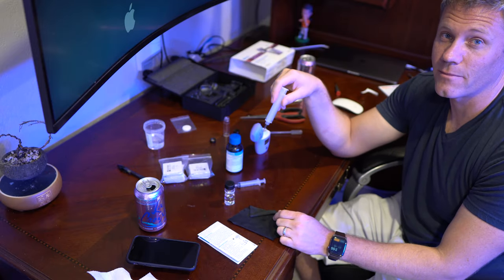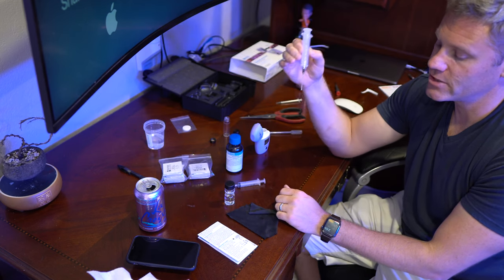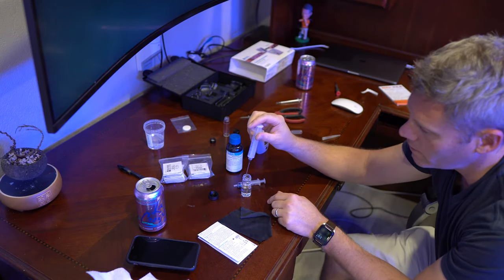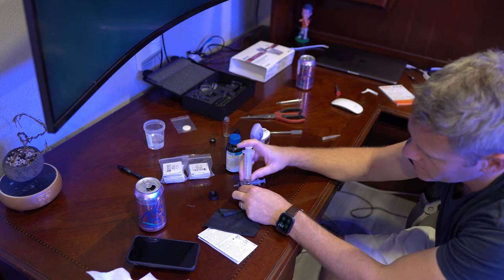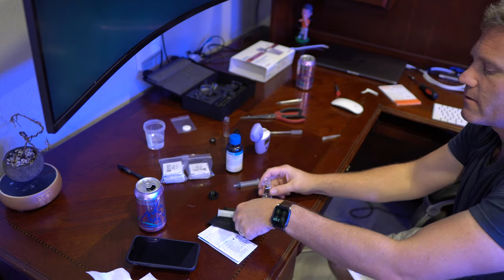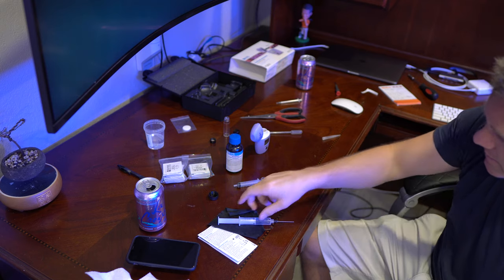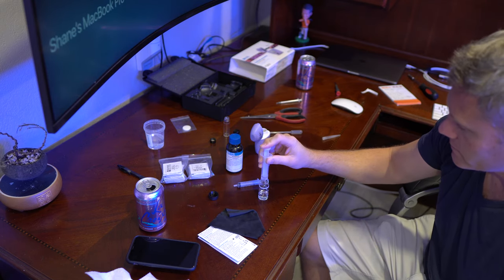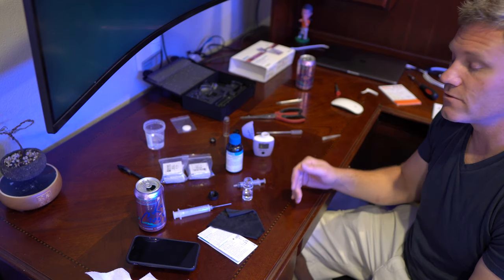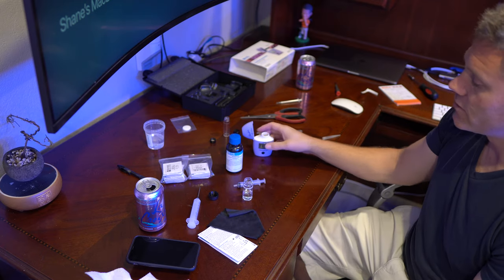The logic is that having exactly seven milliliters — which is easy to get with a syringe — is more important than making sure your dilution is perfectly precise. When you go to pull the seven out, keep the tip all the way down at the bottom and pull up slowly until you get to exactly seven. Discard the remaining liquid. Pro tip: dump it out, give it a little shake to get all that liquid out. Now put the seven milliliters of diluted solution back in. If your parts per million is under five, you don't have to do the dilution — just put exactly seven milliliters of tank water using this syringe. If you do dilute, multiply your results by ten.